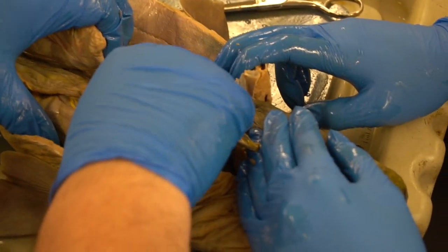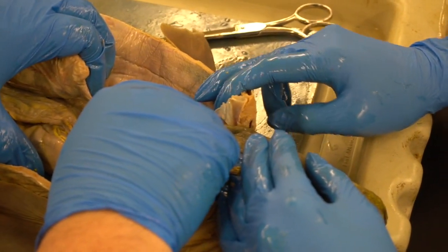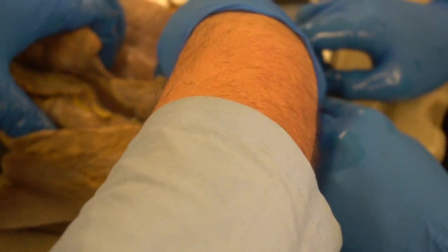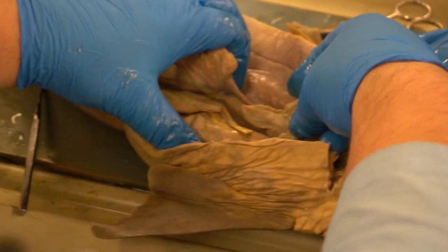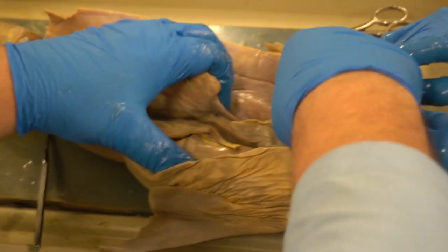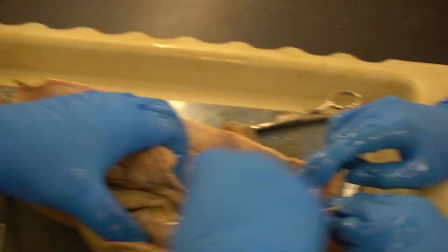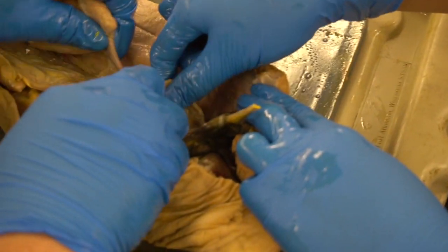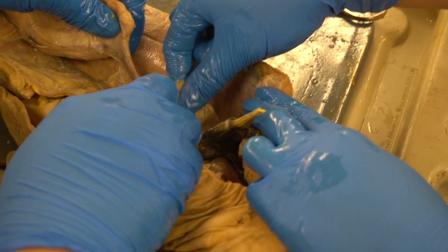Okay, the ovary. What's the job of an ovary? To make what? Eggs. Here, there's nothing left. It looks very glandular. If I feel it, there's a little bit of hard tissue in there. That would maybe be the next generation of egg follicles being developed. But those eggs, as they develop, pass down this tube called the oviduct.